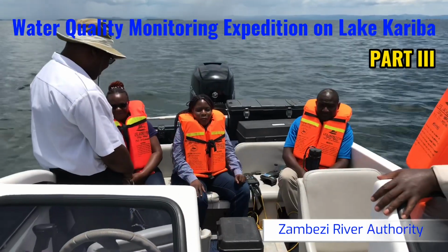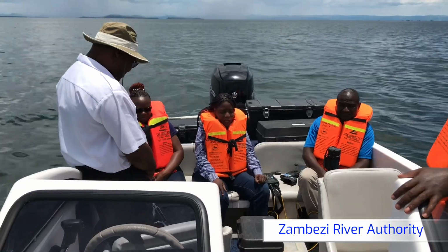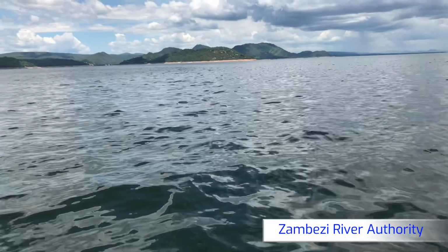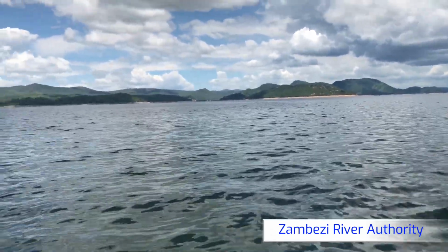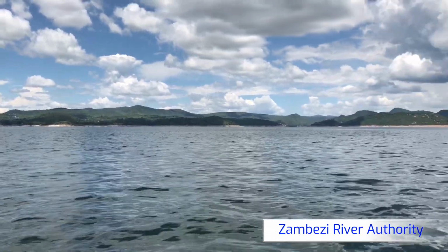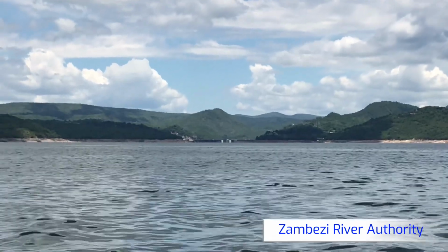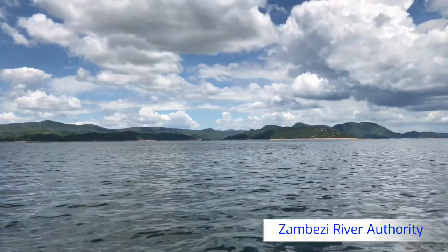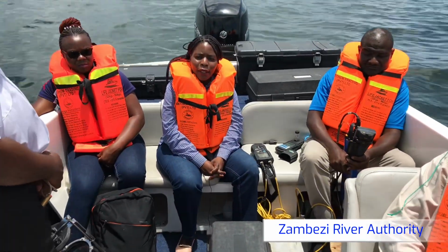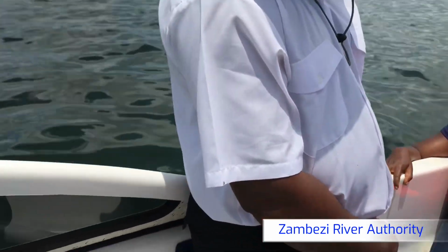Welcome back, our viewers. We are at our sampling station B51, where we normally do profiling. We pick samples from 0.5 meters depth, 10.0 meter depth, at 20 meters, at 30, and 50 meters. At the moment, the depth at this point is about 71.6 meters or so.